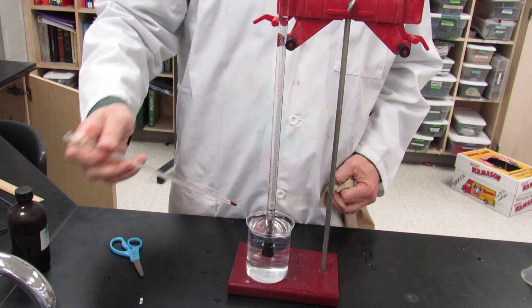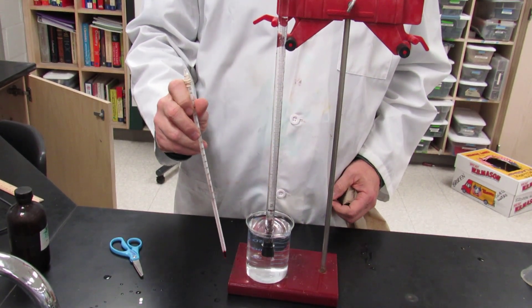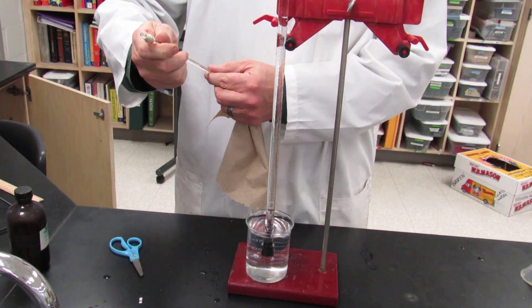Or you can just measure the temperature of the air, it really doesn't matter. If you do it very quickly, the water is going to be closer to the temperature of the gas. If you take your time, the air is going to be the temperature of the gas.